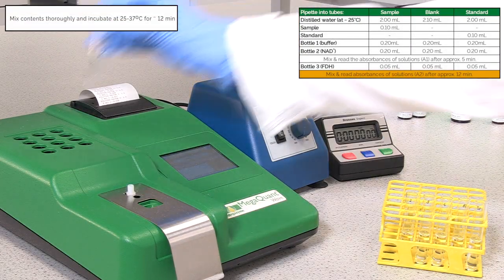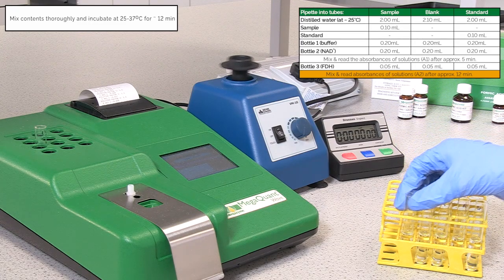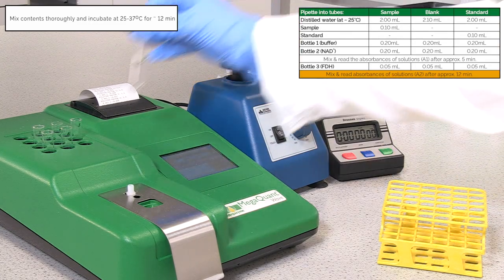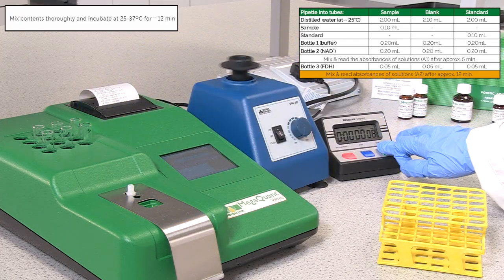Mix the tube contents thoroughly and incubate the tubes between 25 to 37 degrees Celsius for 12 minutes to allow the reaction to go to completion.